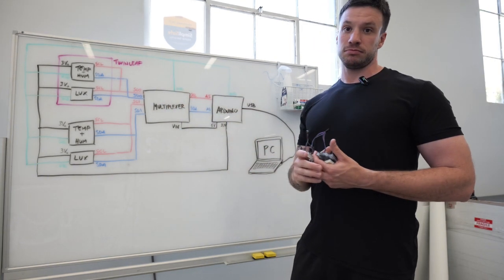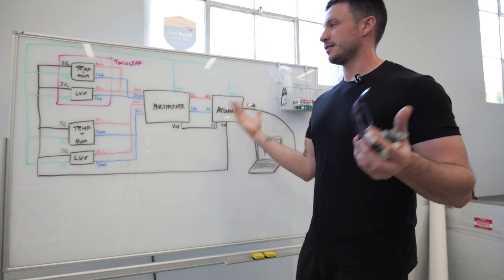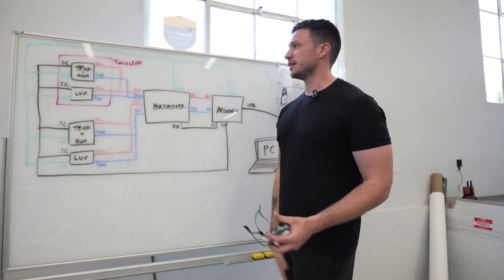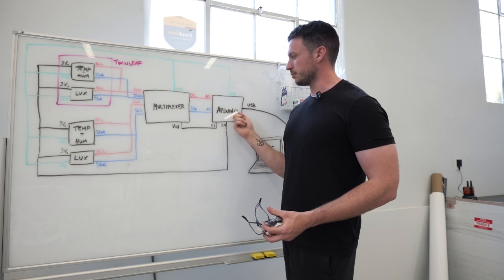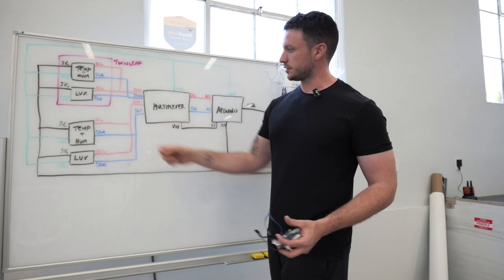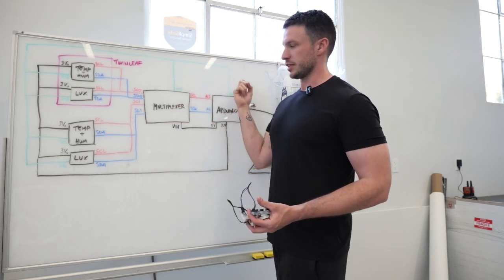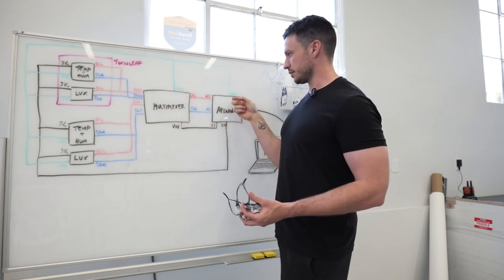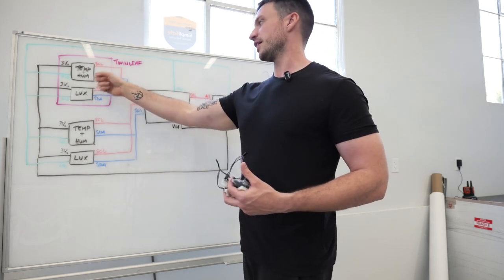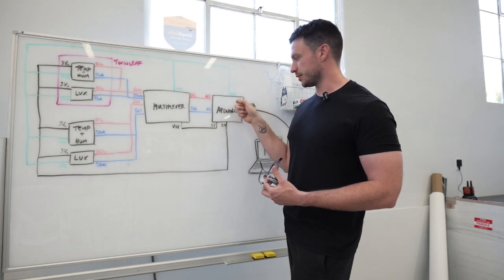And yeah, so if you need more explanations about this whole scheme, I can certainly do that, write a comment down below, but the idea is that the Arduino will supply power through this black cable to the sensors and the multiplexer as well. There's going to be everything connected to the ground through the Arduino. And again, these communication channels are these SCL and SDA, which are split through the multiplexer and then go and communicate with the Arduino.